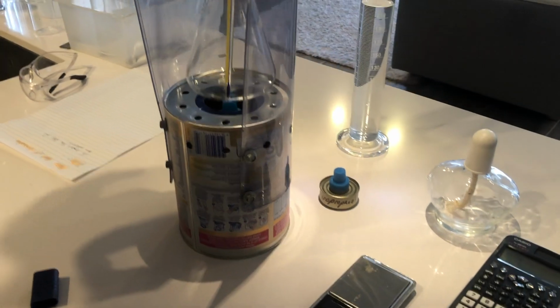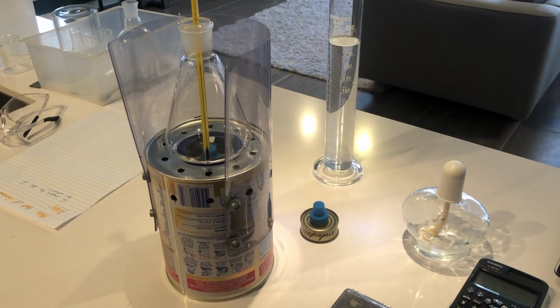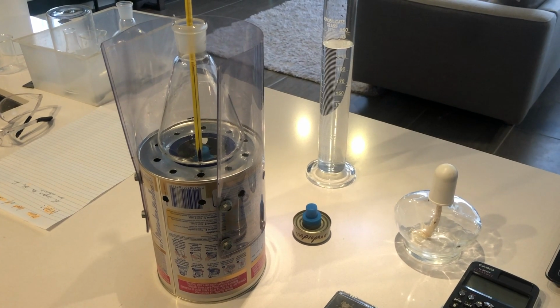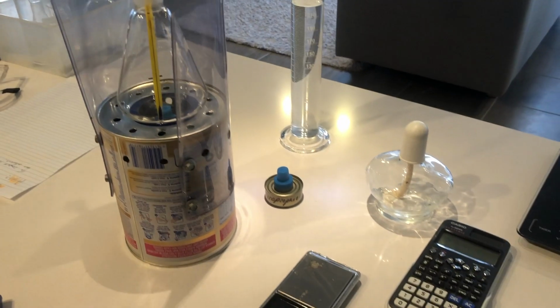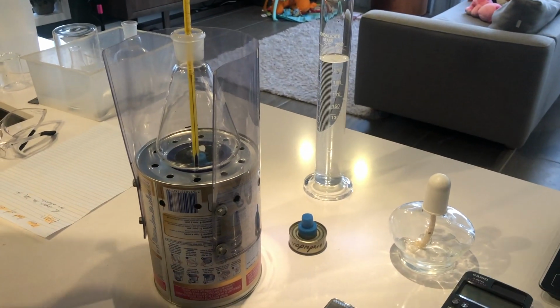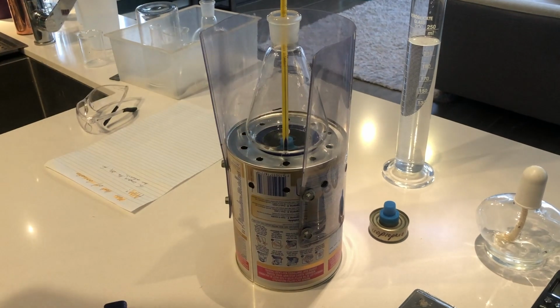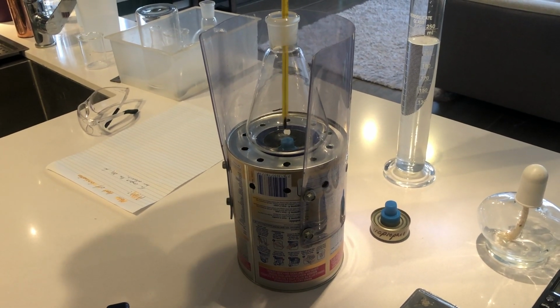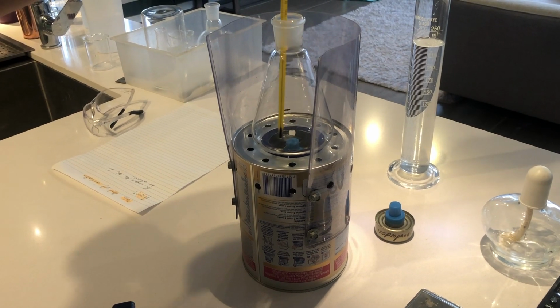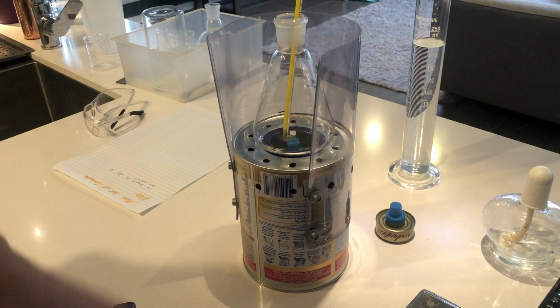Because what we're going to do at the end, after 5 minutes, we're going to pop the blue cap back on, reweigh that in order to find the final mass of the burner, and that final mass of the burner will give us the amount of alcohol burnt. So a bit of a windshield here. We're going to prevent as much heat loss as possible. As I said, we'll heat it for 5 minutes. A bit of stirring is a good idea to make sure the entire mass of water that we put in there absorbs that amount of energy.